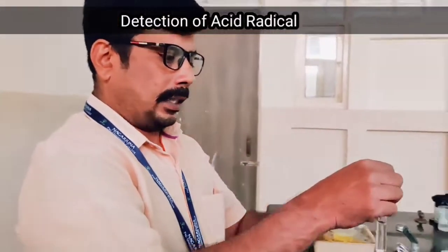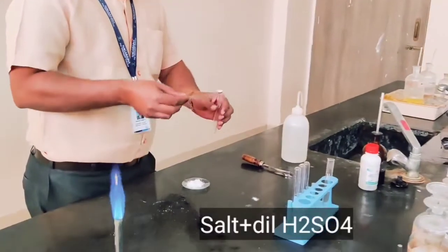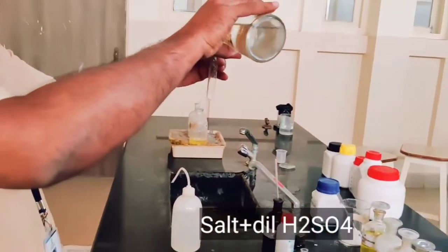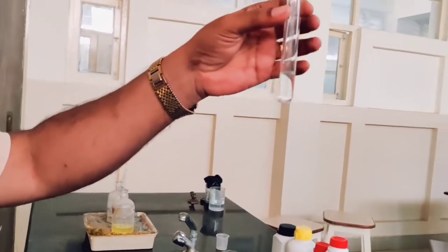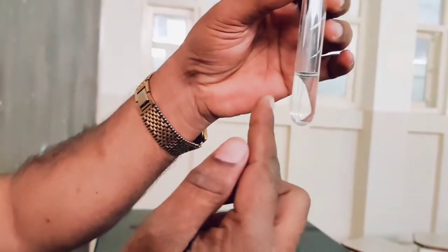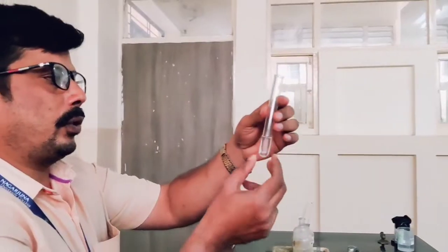Next is the analysis of the acid radical. For the first group acid radical test, take a test tube, add a pinch of salt, and add dilute sulfuric acid. Observe the test tube — there is no reaction here, no brisk effervescence. This indicates that the first group acid radicals are absent, so carbonate is absent.